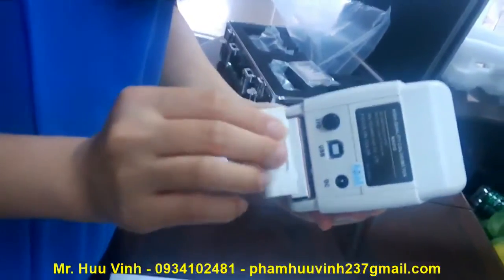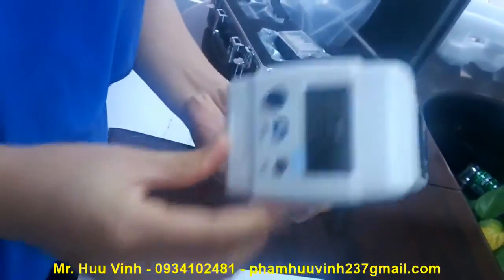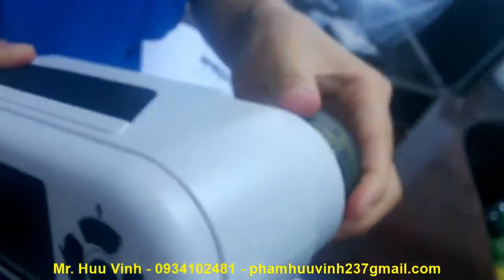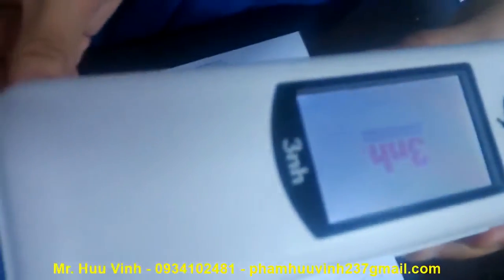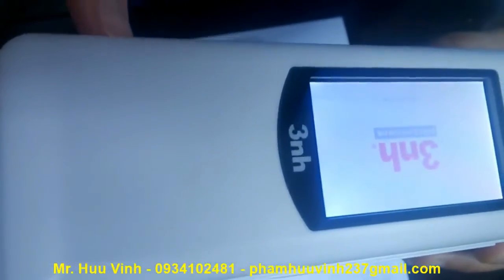First, install the battery here. Then take the white calibration board and put this on the aperture. Then press the power on button. This instrument will calibrate automatically.